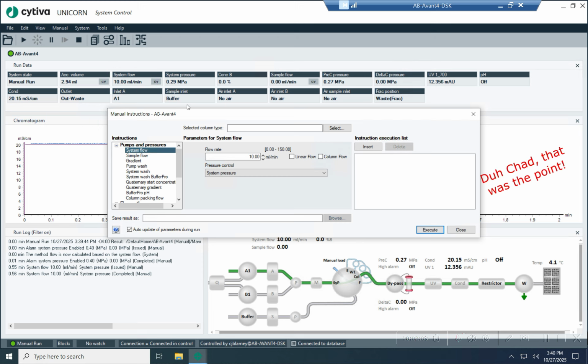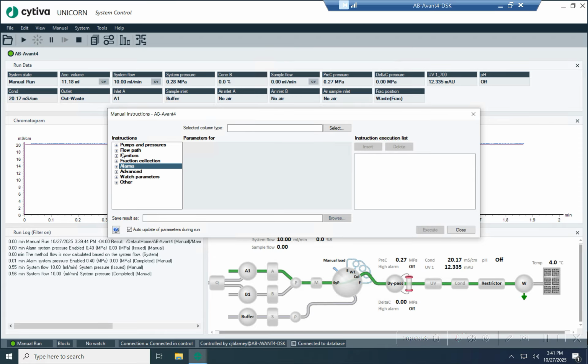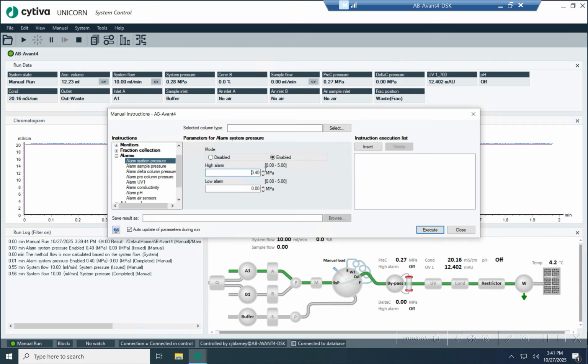Not only can I adjust the ramp up period, but I can also adjust it down. So I am going to change the alarm to 0.3 megapascals, and you'll see the flow rate adjust down. All right, so you'll notice that the flow rate currently is going down. It should level off at some point.